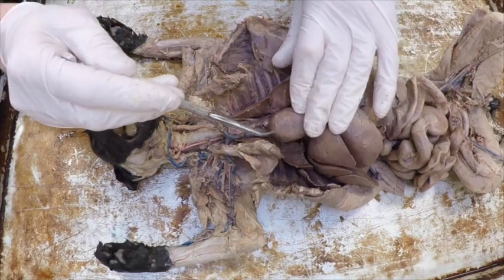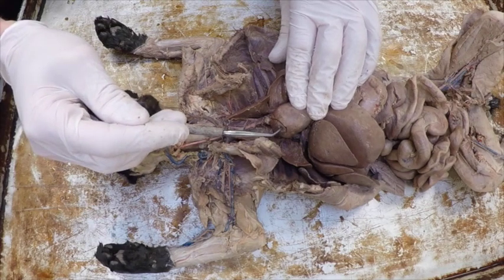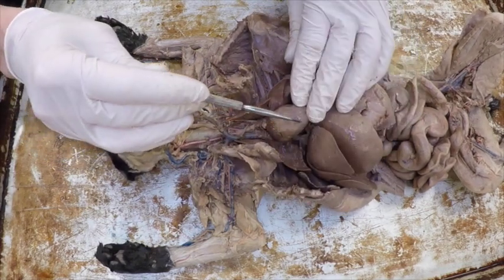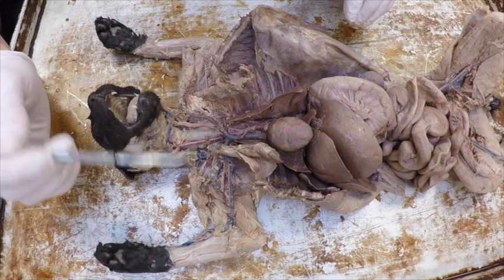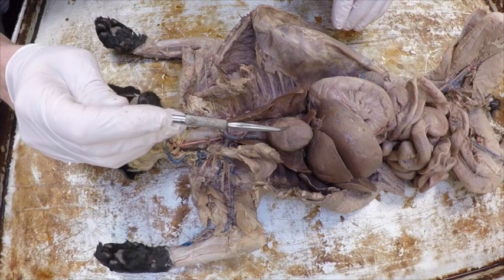And then you have the chambers of the heart. The chambers of the heart, it's the cat's right, so it's the right atrium, left atrium, I kind of twist it over, right ventricle, left ventricle. Then if we get into the arteries and we start working through our arteries and veins, we can start with the ones on the heart to begin with.